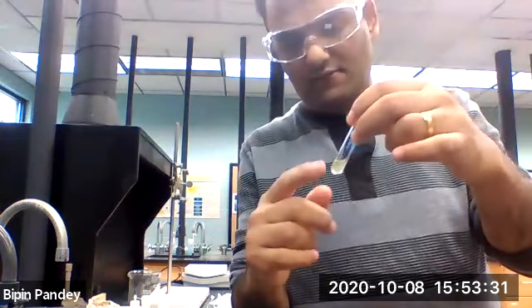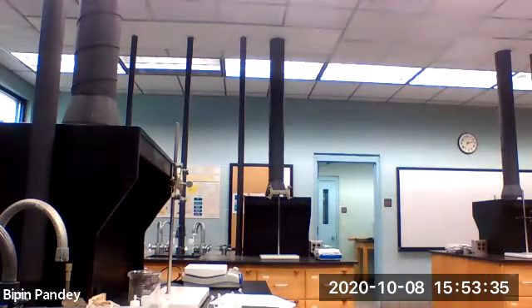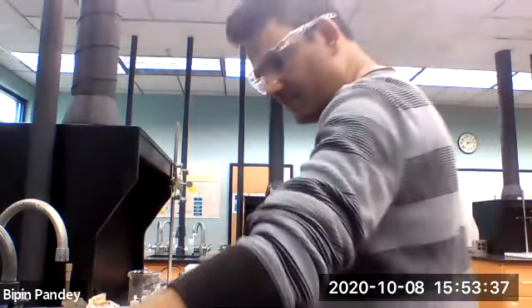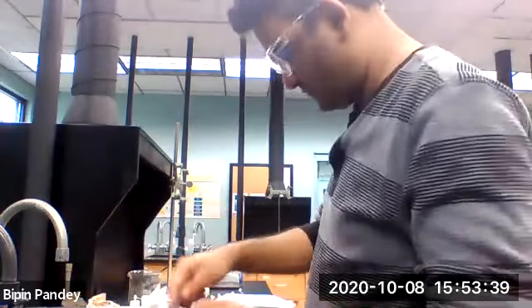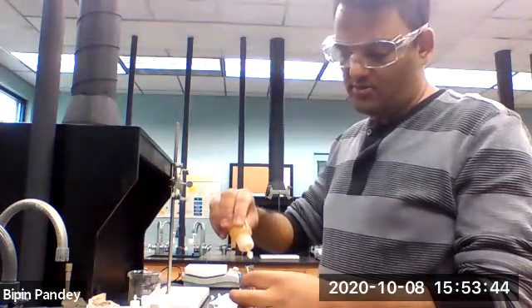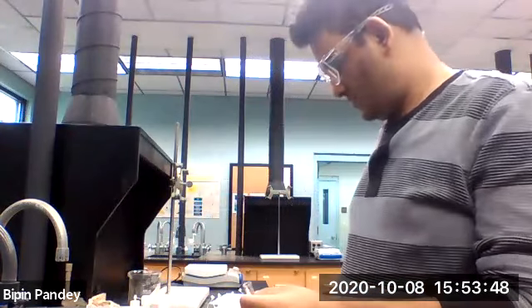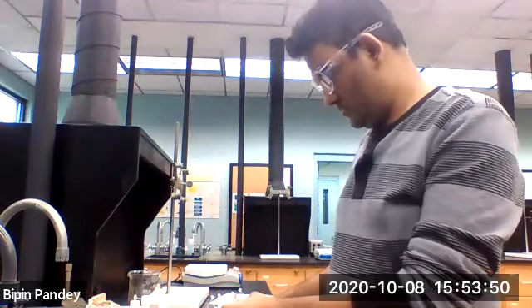I don't see any solid formation, so I'll say no reaction. Iron 2 chloride, and then sodium iodide.